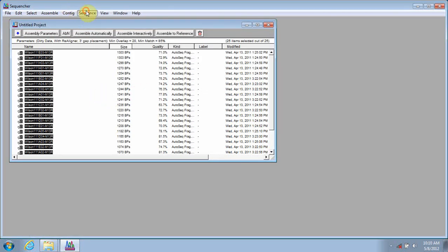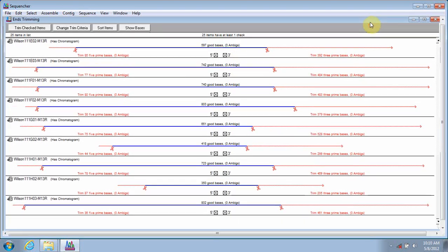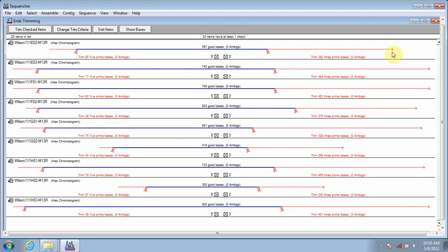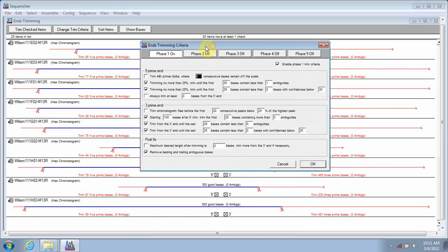So I'll go ahead and open my trim ends menu, and this will open up our overview screen. It's always going to tell you pretty clearly what it's proposing to do on each end of the sequence. So in order to view and set your trim criteria, simply hit this button and pull up the ends trimming menu. Notice you have several options from the 5' and 3' ends. You can choose to trim off ambiguous bases, you can choose to trim by confidence, and you can always choose to trim X amount of bases from the 5' end as well.